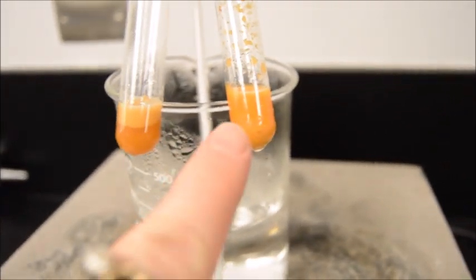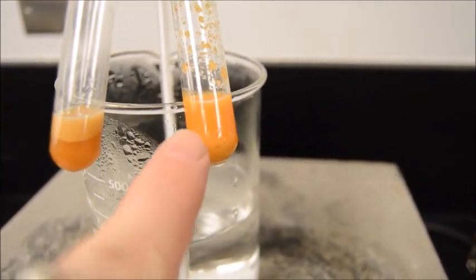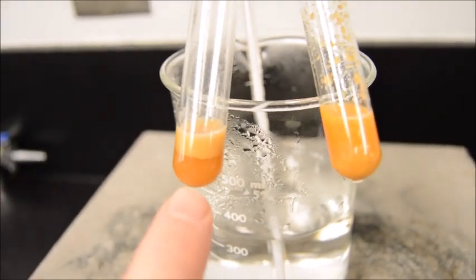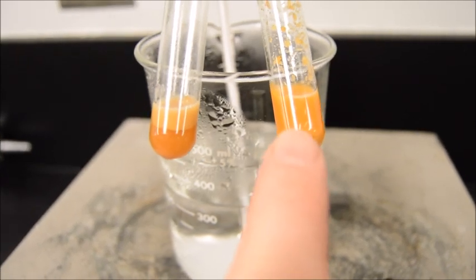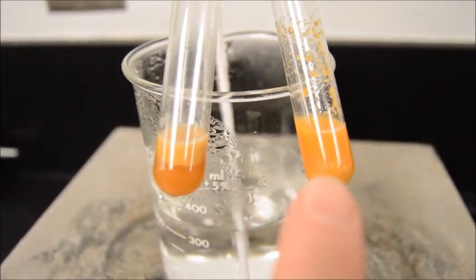Now, if you're not here, this is much more of a reddish orange, and this is more of a burnt orange, kind of a light orange coloration to it. This one was much slower. This one was much more intensive from my perspective. Ms. Rose, would you agree? I would agree.